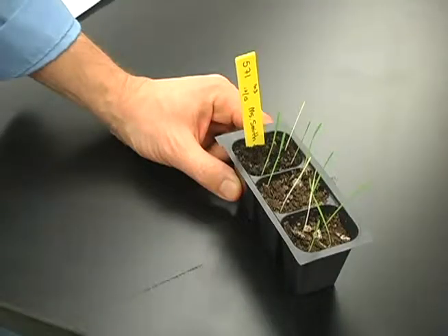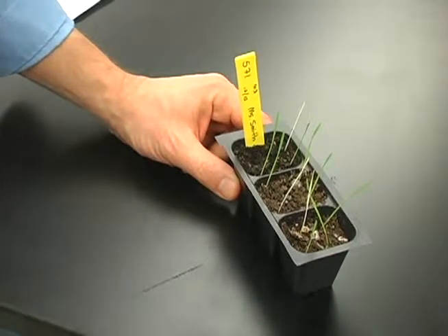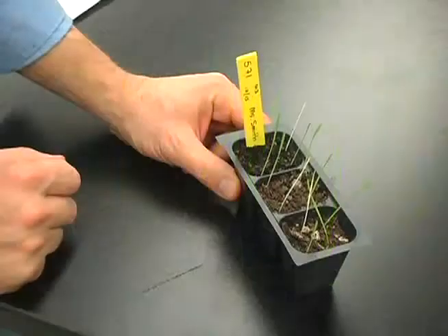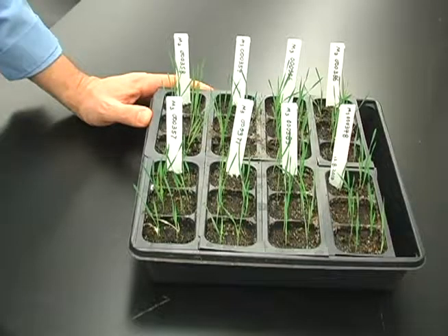It'll be very important for you to compare your mutant plants to the wild type at each of the 3 different screenings. Your first screen will take place a week after germination. Here's one family where you can see mutants segregating. You can see there are white plants, we call these albinos, and you should see more than one white plant per family. You should perform the second screen 2 or 3 weeks after germination.